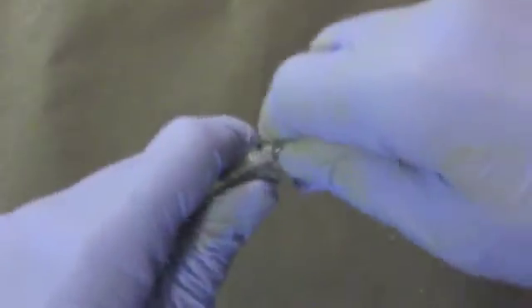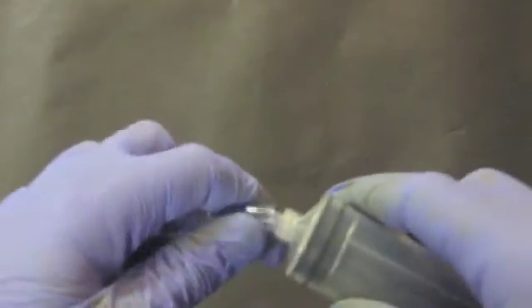Connect your tubing to a funnel, making sure it is a tight fit. Connect the other end of the tubing to a smaller piece of tubing, and connect that tubing to a syringe. Do not simply connect the large tubing directly to the syringe, as the smaller length of tubing will be necessary when we dry our product.